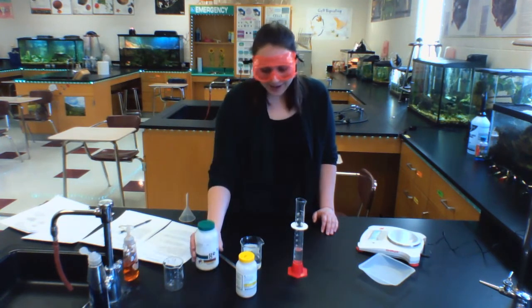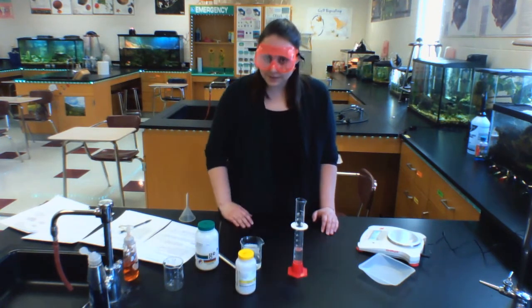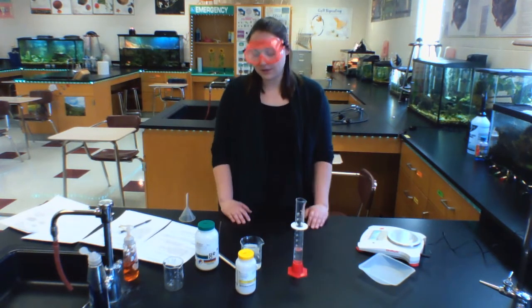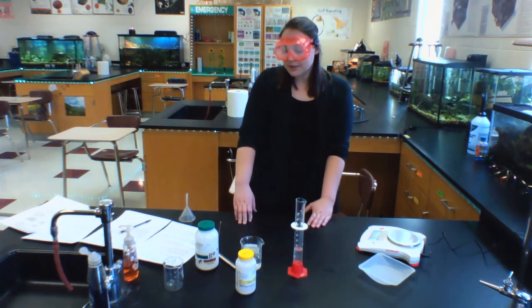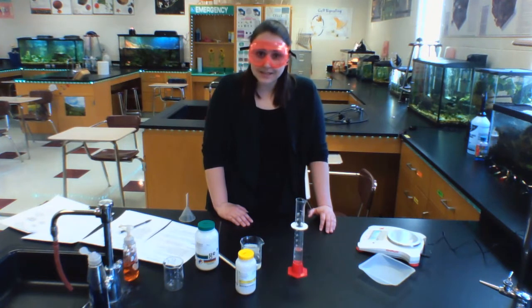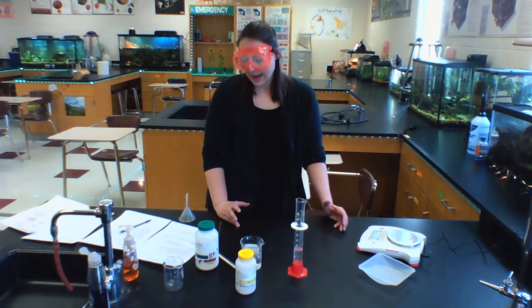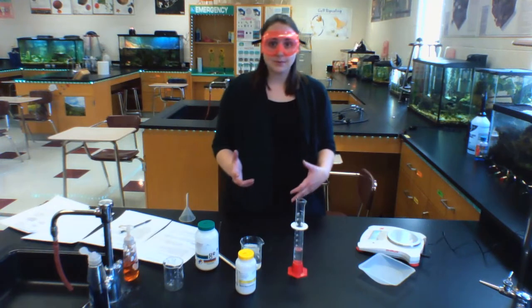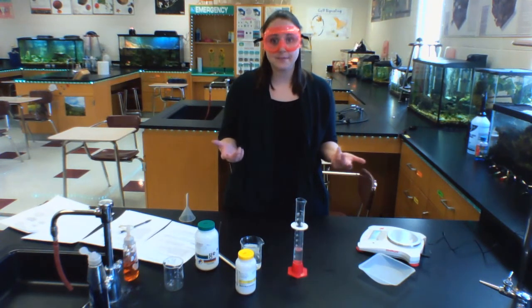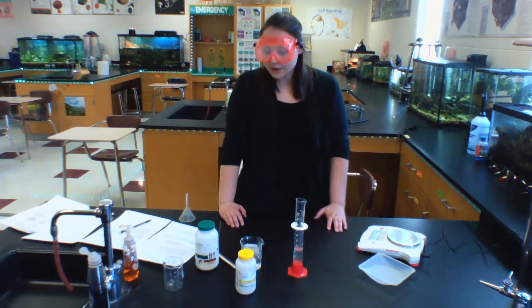So two reactants, potassium iodide and lead nitrate, are going to come together and do a reaction, and we're going to be able to predict which products will be made and also how much of the products will be made based on the materials that we have used. So we want to think about, when you have a reaction between lead nitrate and potassium iodide, what kind of reaction is that? What reaction is taking place? Which category of reaction is it? Is it a double replacement, single replacement, decomposition, synthesis? What kind of reaction is that?